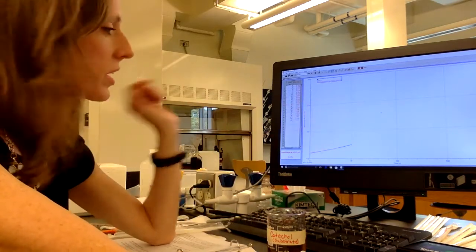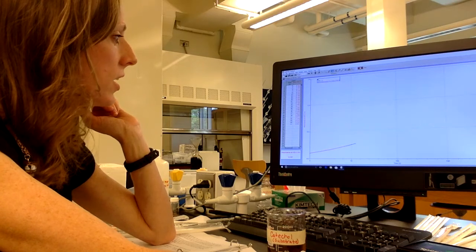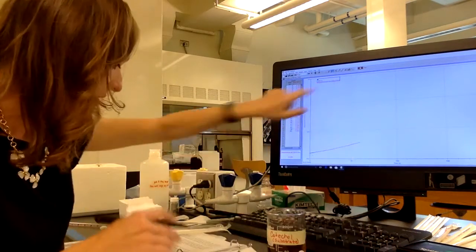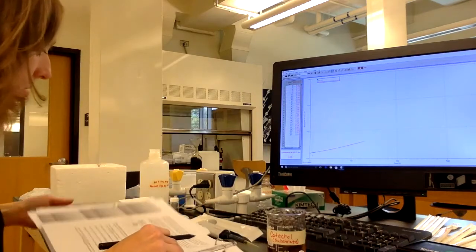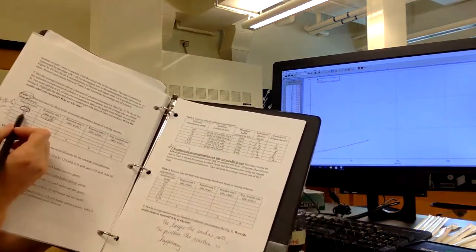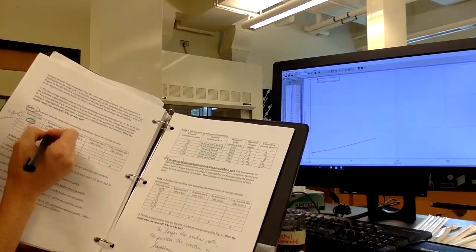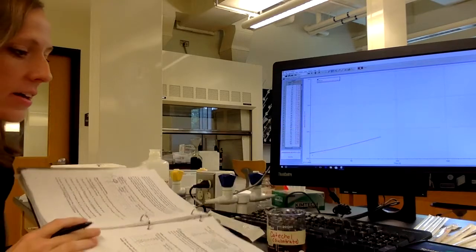Now it is still increasing. So we're gonna give it a little bit more time. But again, if I use my tangent button and draw it over to the initial part of that graph, I can take the slope of that line and record that then in my lab manual on table 2, okay, at the 50 units per liter reaction 1. Okay, so the number I get for that at this point is 0.00247, okay?